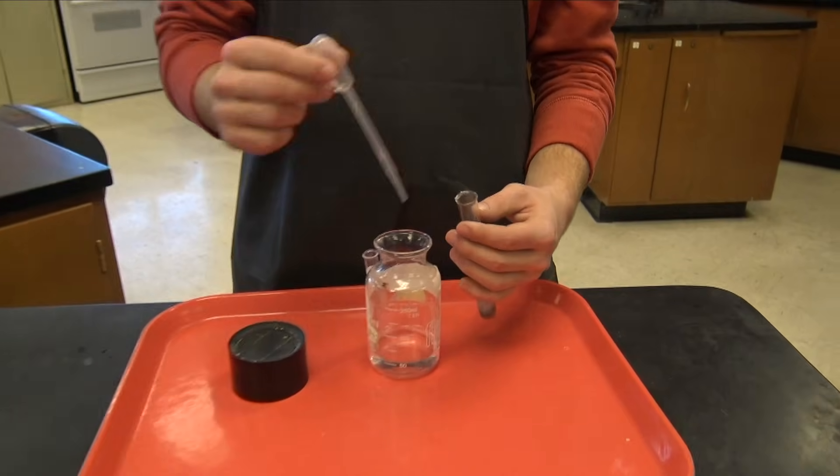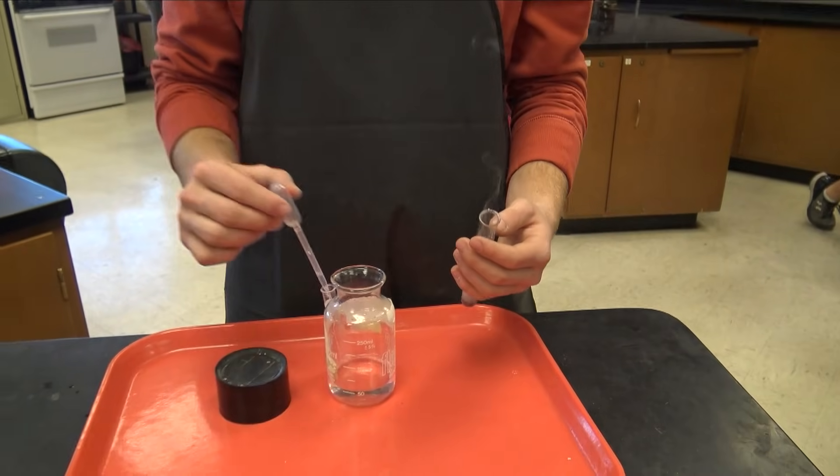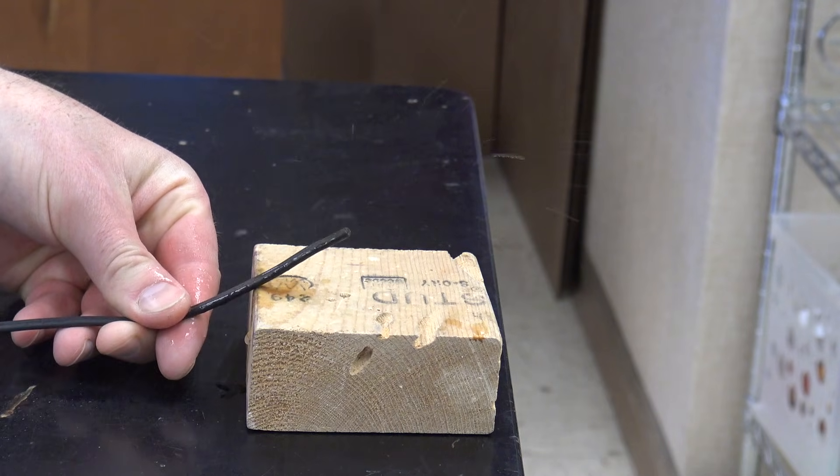Let's make some gas. This is probably a good time to remind you not to try this experiment at home. Hydrochloric acid can be really dangerous. The gases that we're producing, obviously, they're combustible, and when mixed together, they'll go boom. So don't try this one at home.